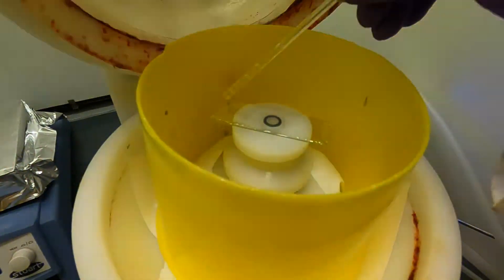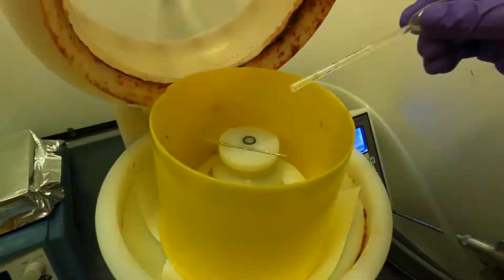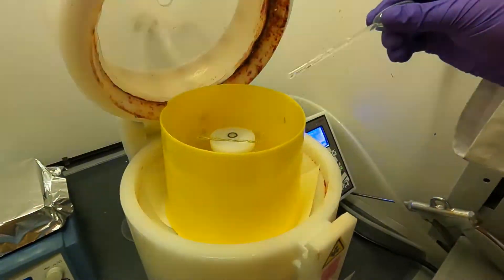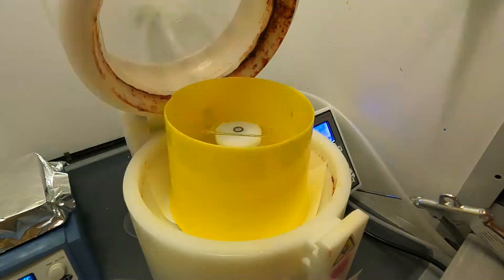The edges in general are not a delicate part of the sample, so we don't really want to care too much about the edges. It's important that the central part which is going to hold the device is correctly coated with SU8.